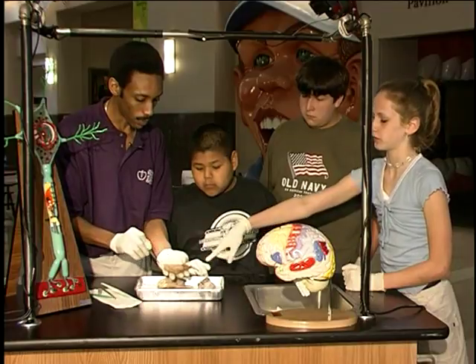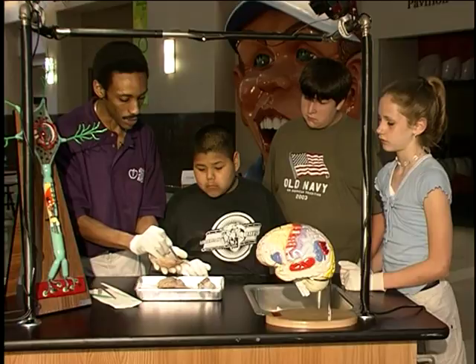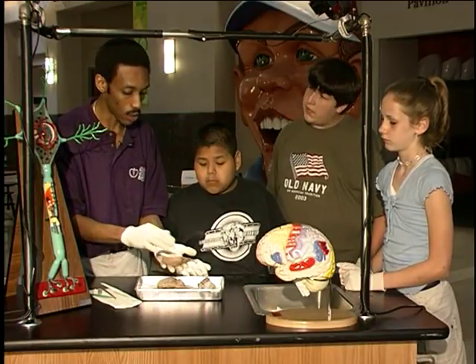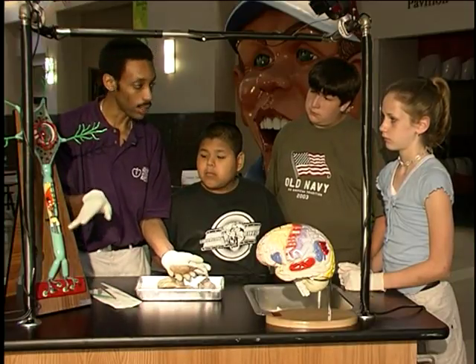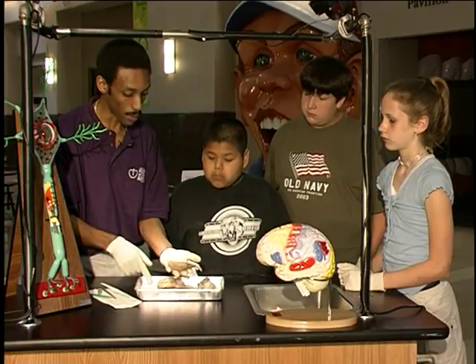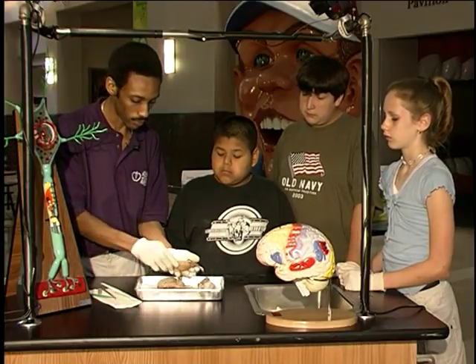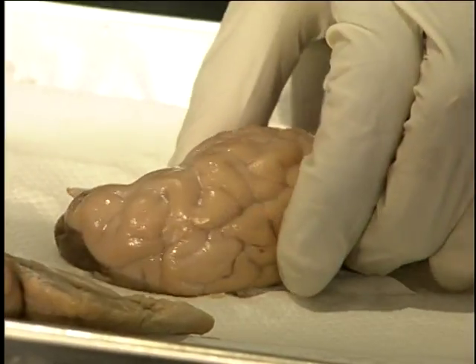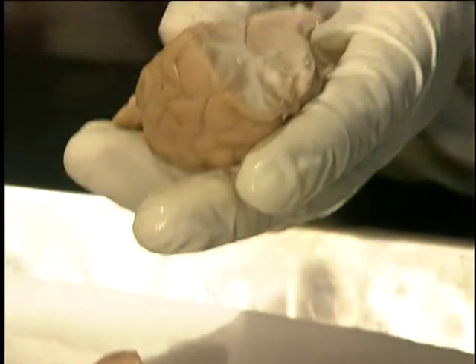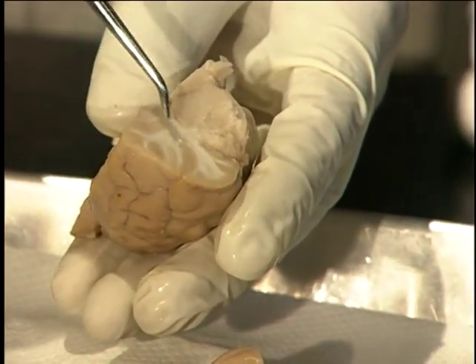What are all the little lines? Good question. The white lines that we see are what we call white matter in the brain. The white matter would be cells that have more myelination, this area of the brain cell here. Whereas the darker colored areas are what we refer to as gray matter. Those would be areas where the dendritic connections are larger. We'll make one more cut into the brain, which will allow us to see a different cross-section. And we can once again see the white matter in comparison to the gray matter.